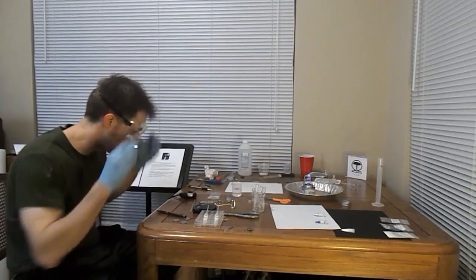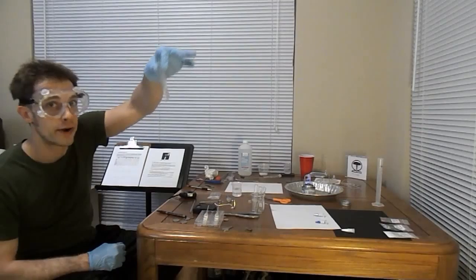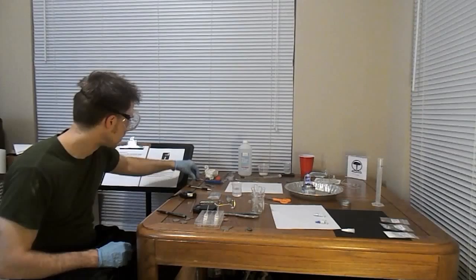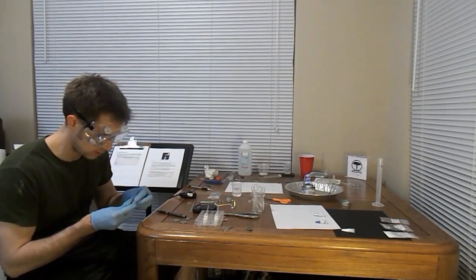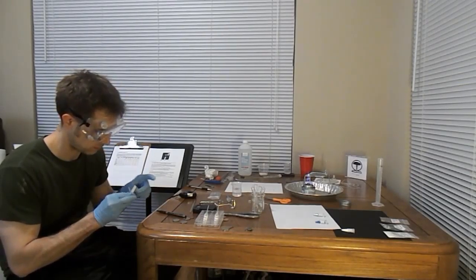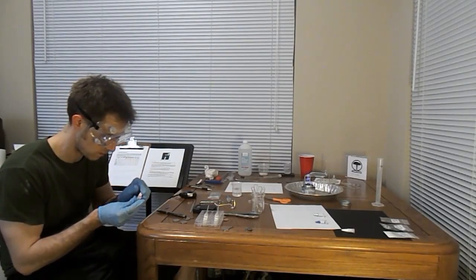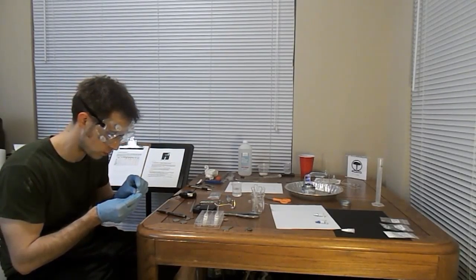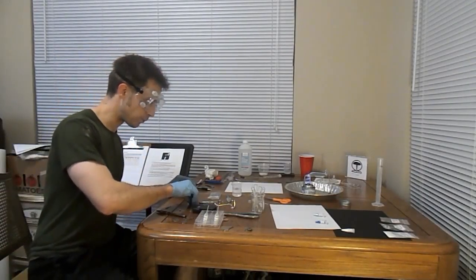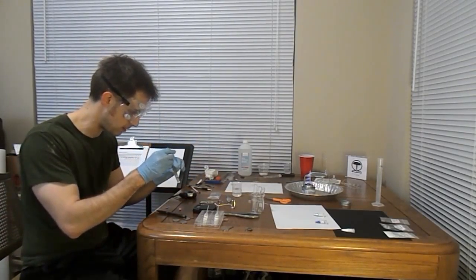Alright, one of the things we almost did is skip a step. Test tube 2 has the distilled water added to the mystery substance, in this case still magnesium. And one of the things I needed to do with it is take this piece of blue litmus paper and this piece of red litmus paper using the stirring rod device.